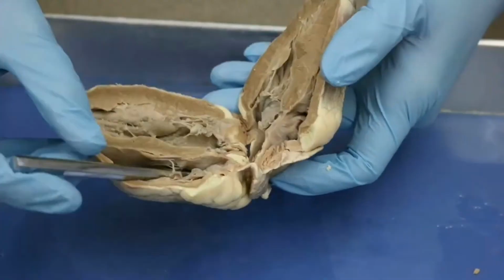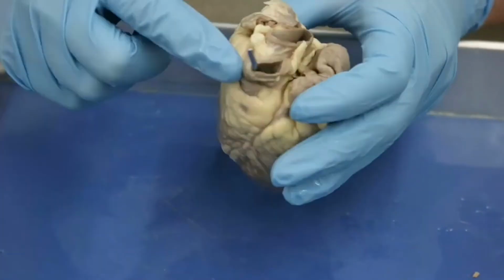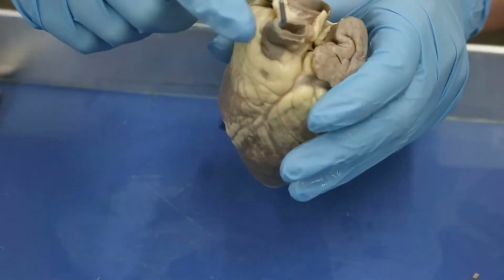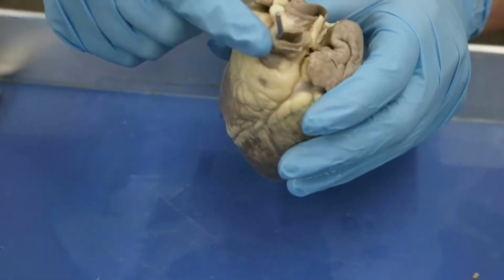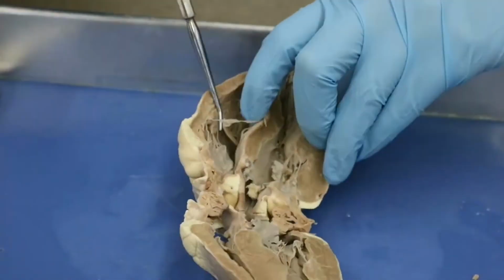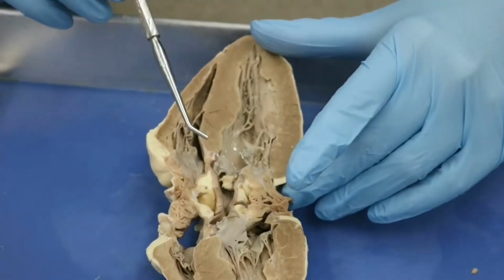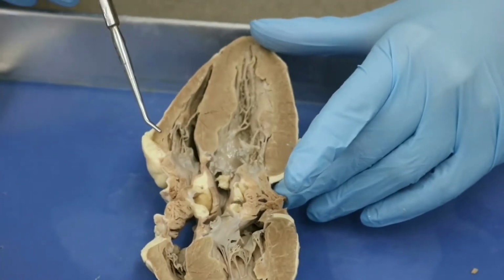Okay, so we went from the right ventricle out through this vessel, confirming that we were correct before, since we are talking about right-handed things here. We were correct before that this is the pulmonary trunk, okay? Because the pulmonary trunk, of course, is coming off of the right ventricle, okay? Because of the sharp angle here, it is difficult to impossible to see the pulmonary valve, but we can assume that it is up in this direction, okay?